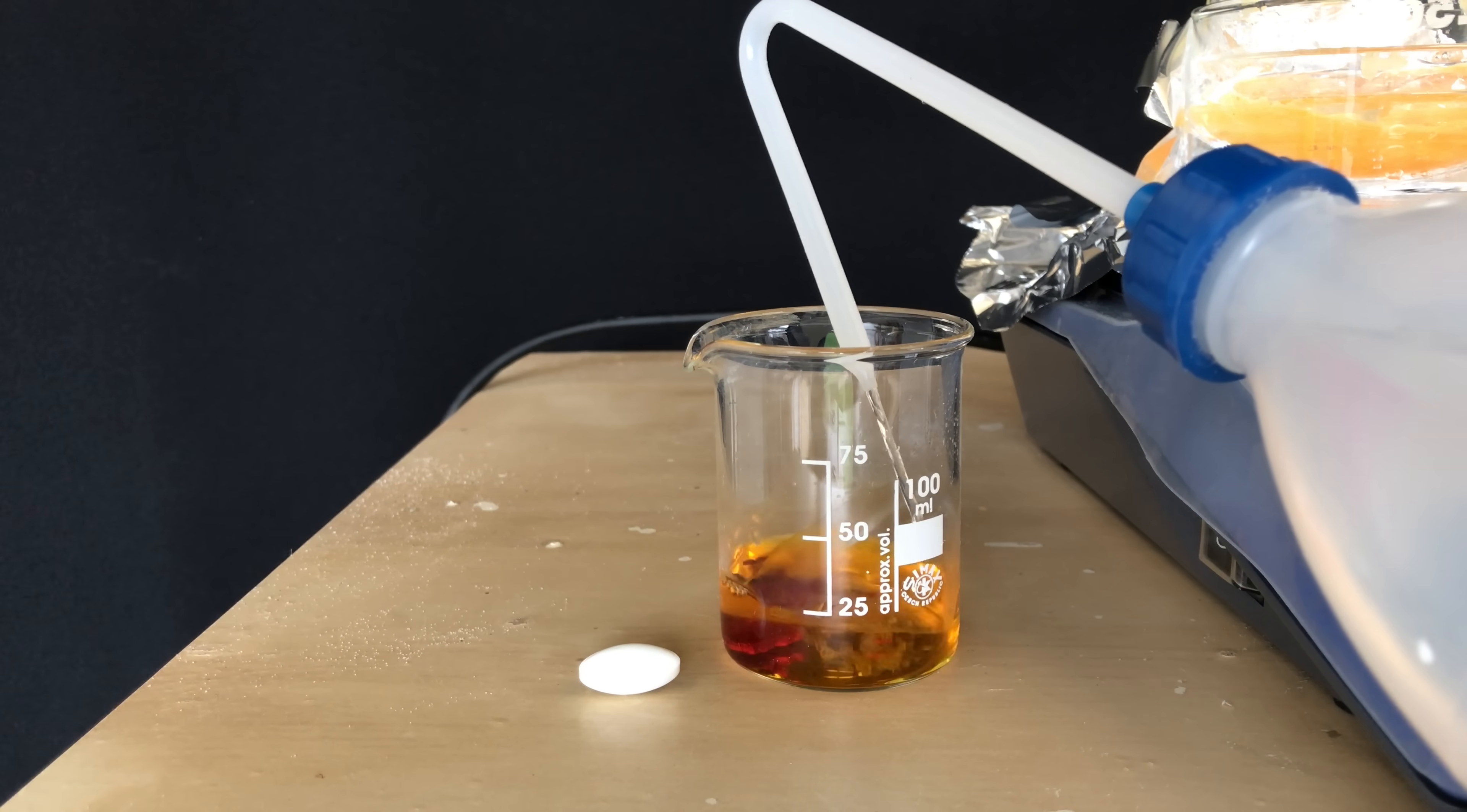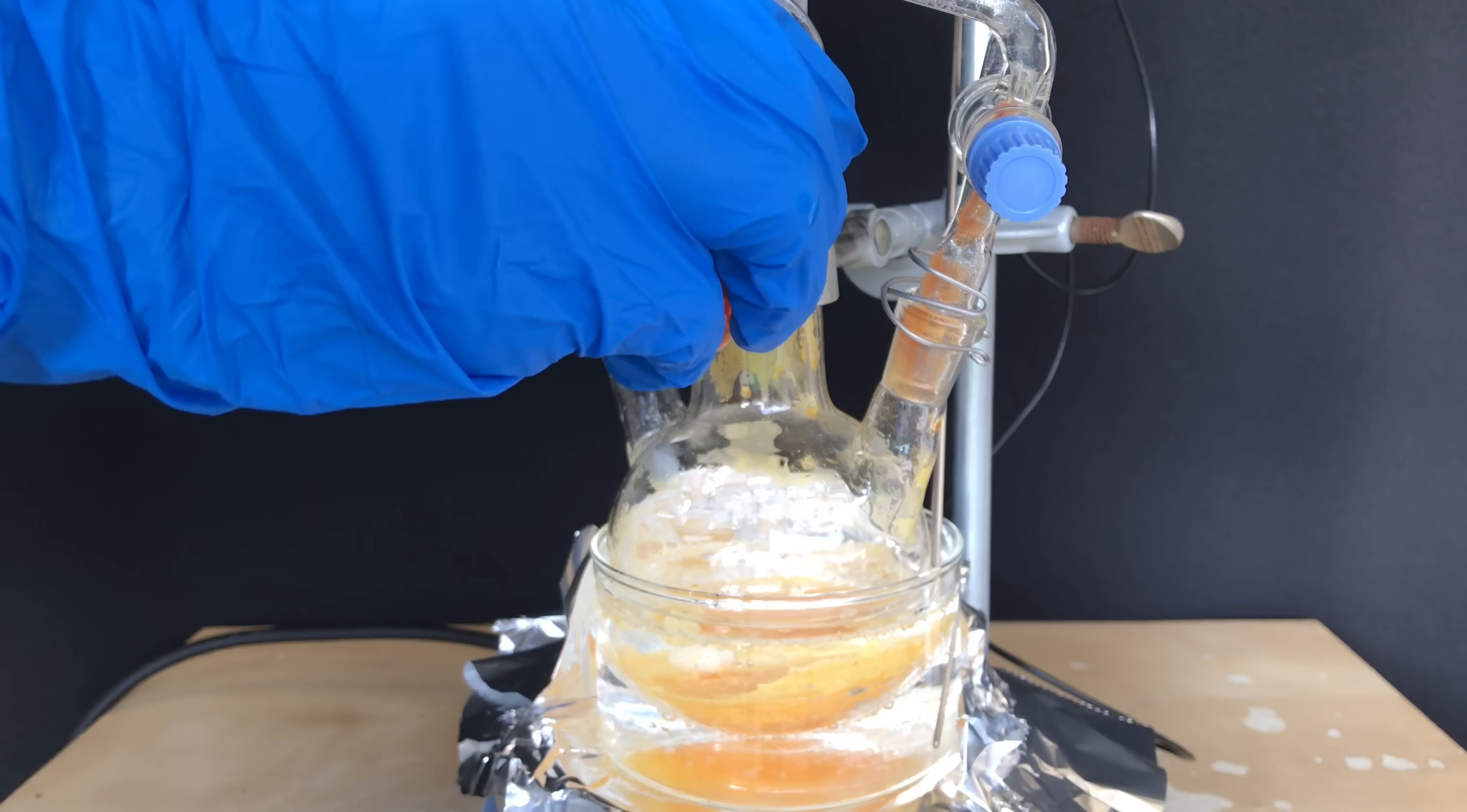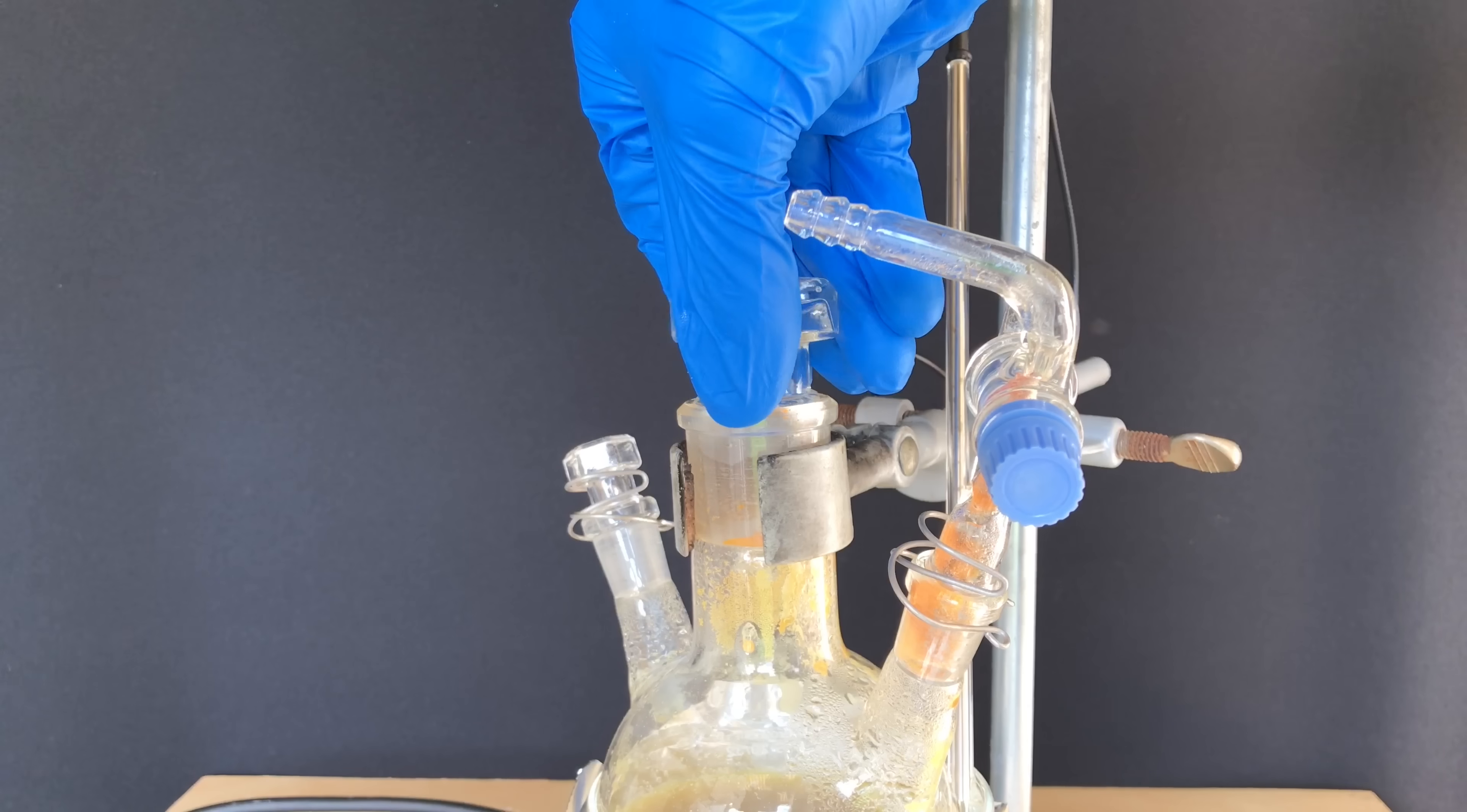At this point we are not only dealing with highly toxic white phosphorus, but also with carcinogenic chromic acid. The solution of chromic acid should be somewhat dilute and therefore I added even more distilled water to the white phosphorus. A small portion of the chromic acid was added and heating and stirring were turned on. Stirring was turned up to the max, but we only set the water temperature to about 60 degrees Celsius as white phosphorus already melts at 44 degrees C.